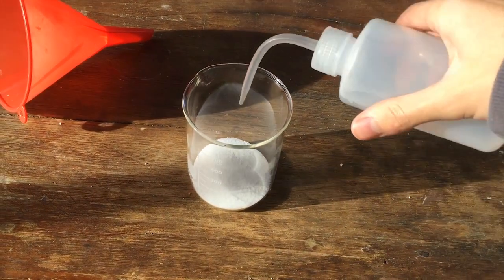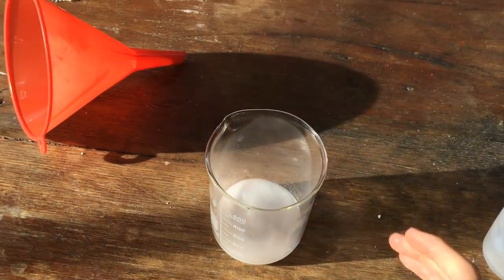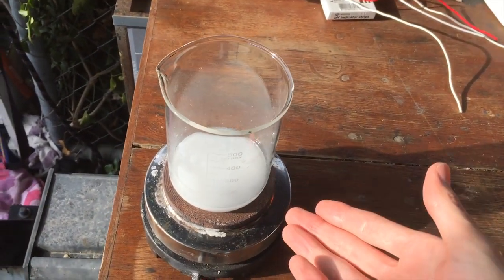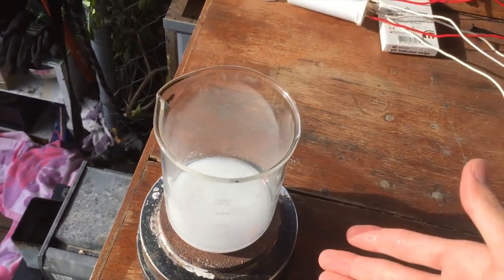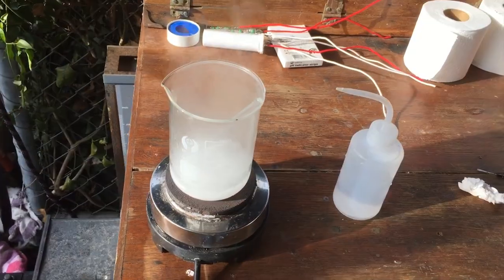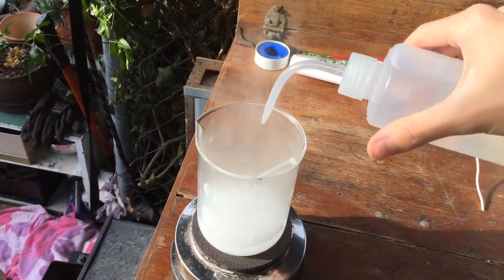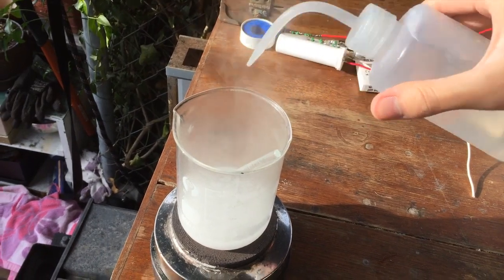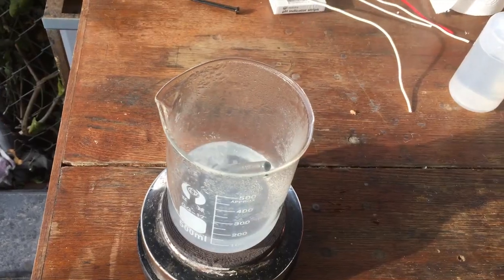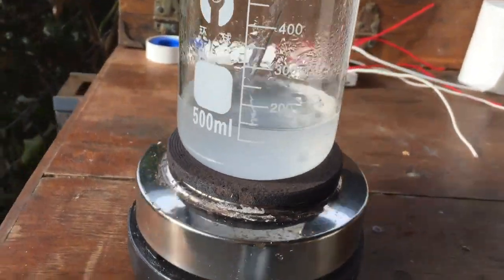Back to what we're doing. I'll add some water to this — we're going to dissolve it all up eventually. I'll put this on the hot plate and slowly heat it up. Once we reach boiling temperatures we'll keep adding water until we've got all of our salt dissolved. We've got it to boil but it hasn't all dissolved, so we'll just add a little bit of water and keep doing that until we do. Everything has just dissolved in around 125 ml of water.